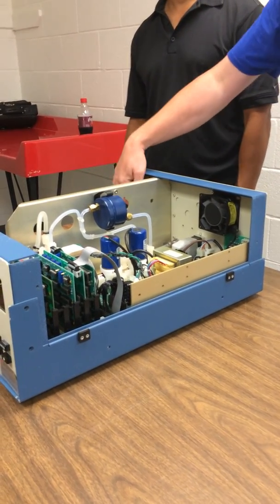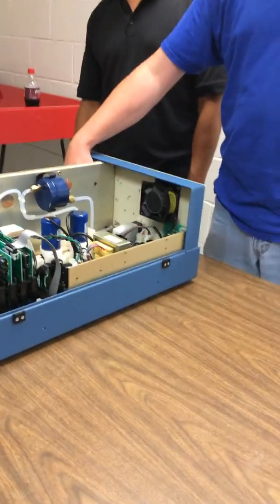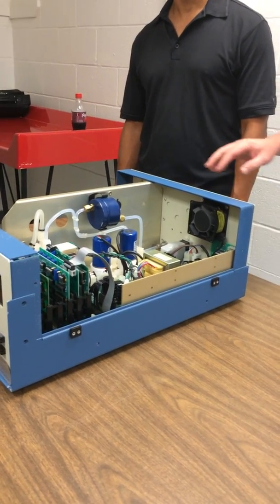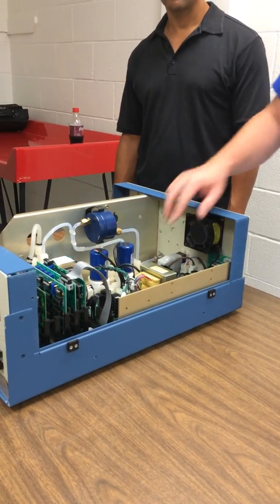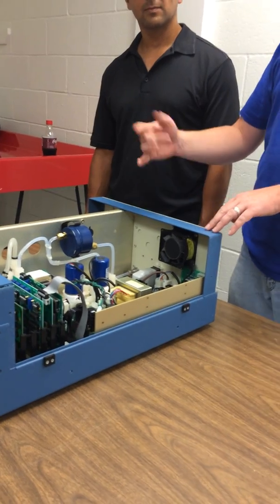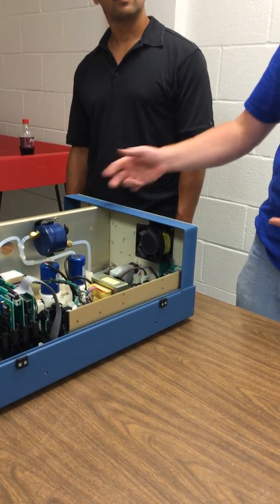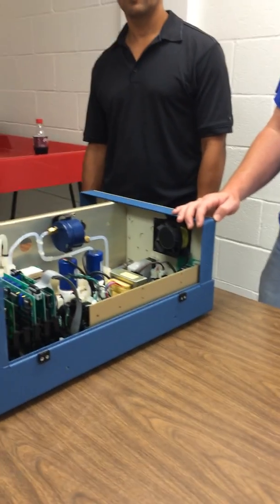There's one light source and it's split by 2 mirrors right here, so that takes out some of the variability. But there are 2 detectors, and one cell could be dirtier than the other. We put filters on it, but they're still going to get a little bit dirty. To take out the differences, these 2 solenoids flip-flop. They fire at the same time and flip-flop which cell is reference and which is not. It makes 4 measurements, both cells twice, and the average of that is the signal it puts out.